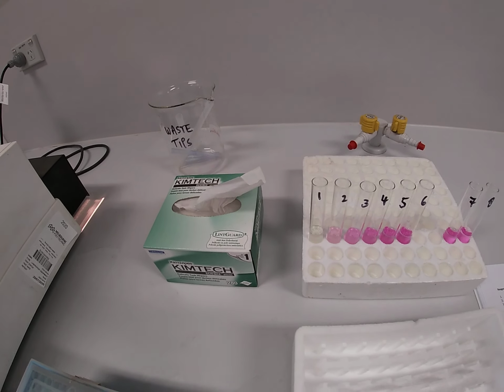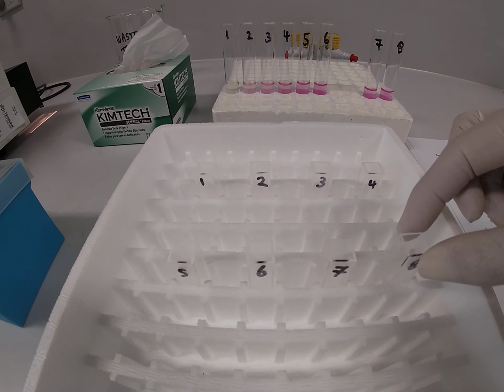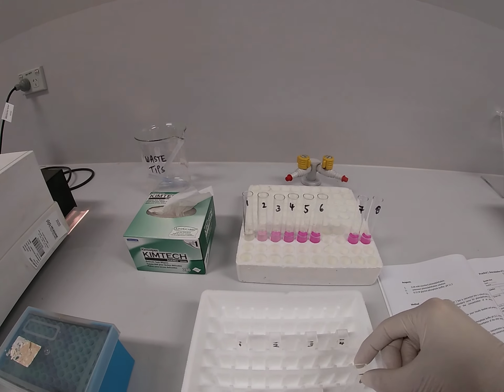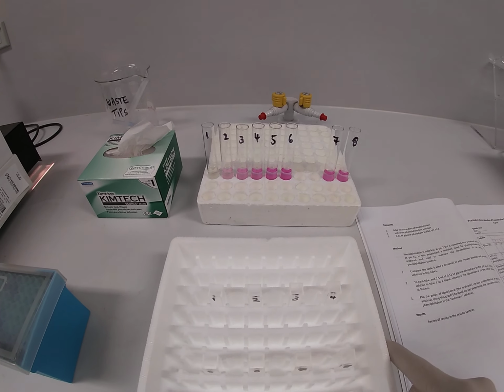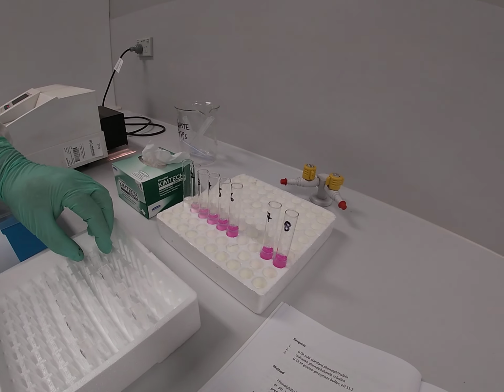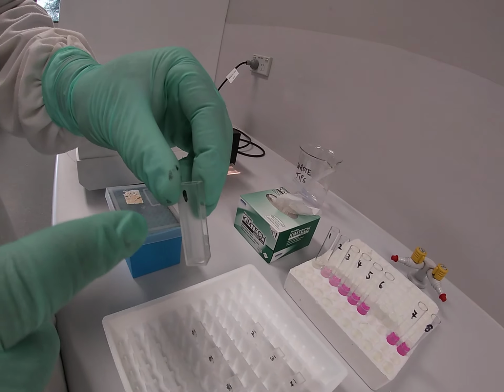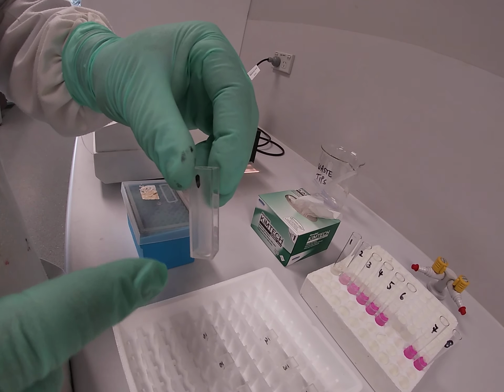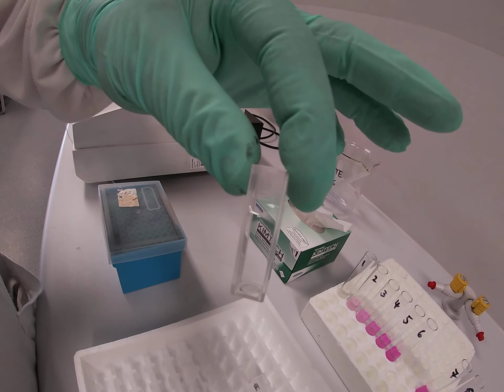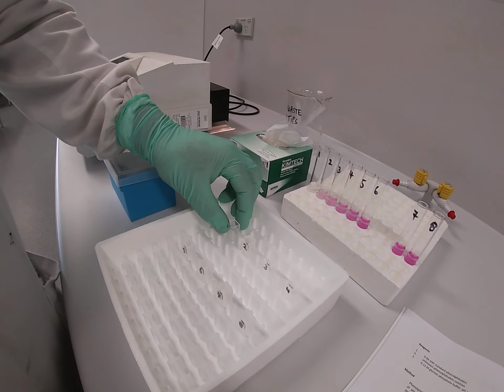All right, so Bob has also set up our cuvettes, as you can see here. They've also been labelled. So Bob's going to transfer solutions from the test tubes into the cuvettes. It's important to note that the labelling, the 1 through to 8, has been done on the cloudy surface, not the clear or transparent surface in which the light is actually going to travel through in order to measure the absorbance using the spectrophotometer.